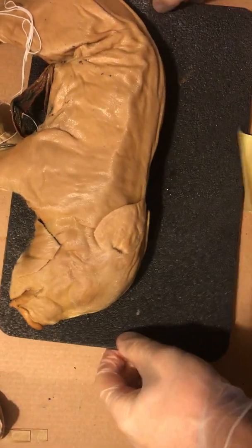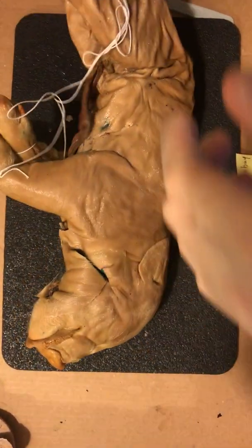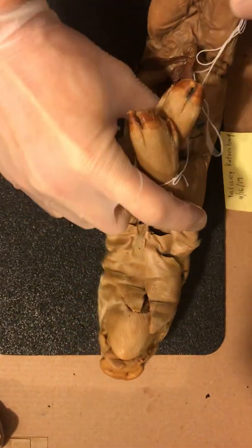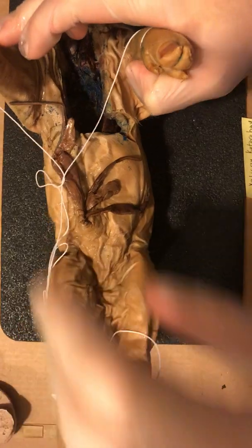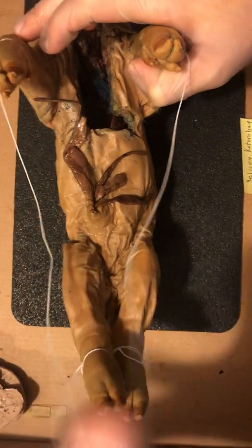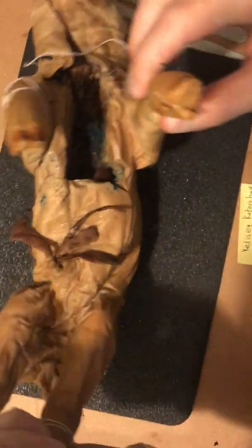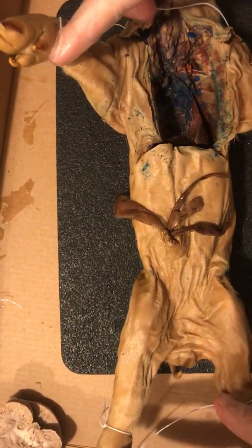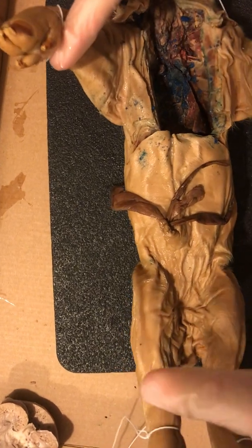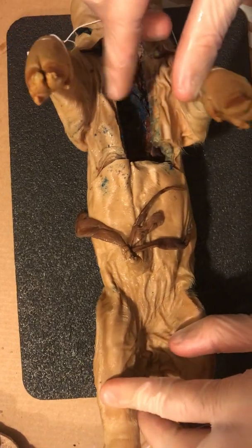Alrighty there then. We come back to our fetal pig, who has already had regions dissected multiple times. Today we're not going into the thoracic cavity, which is basically at this point just a cavity with very little left in it. I think we've got a lung in there, and that's about it. I'll talk you through it really fast because I can't talk and cut at the same time.